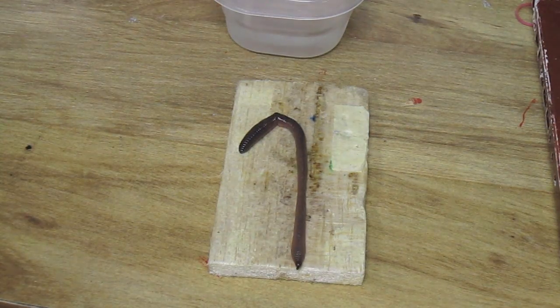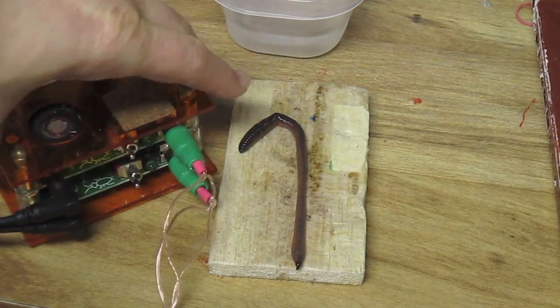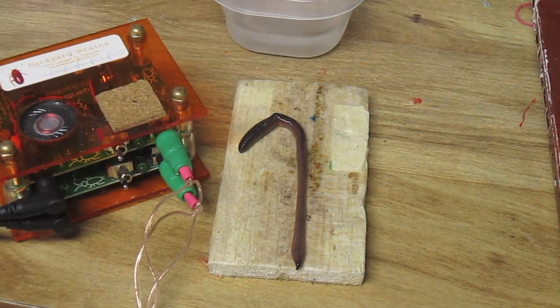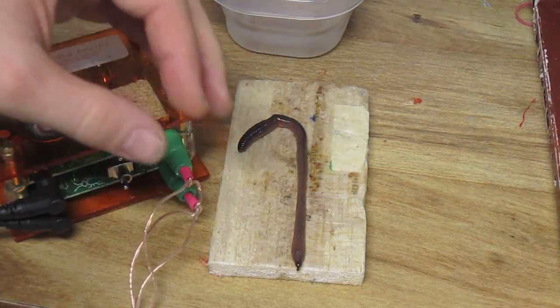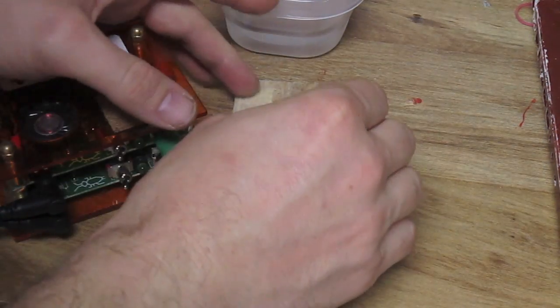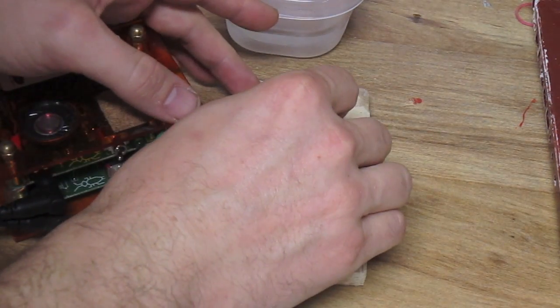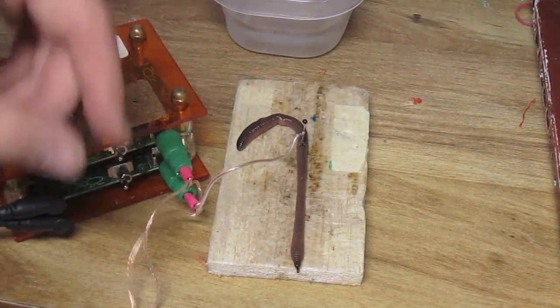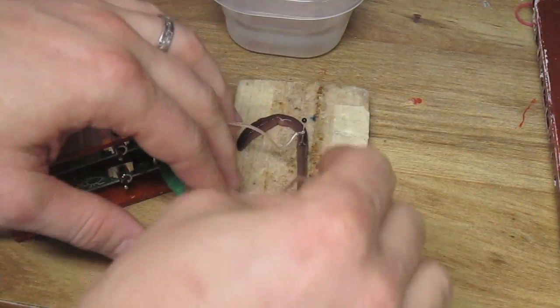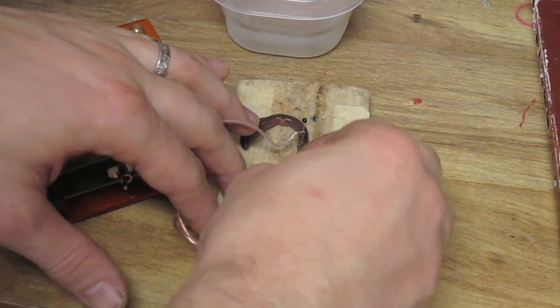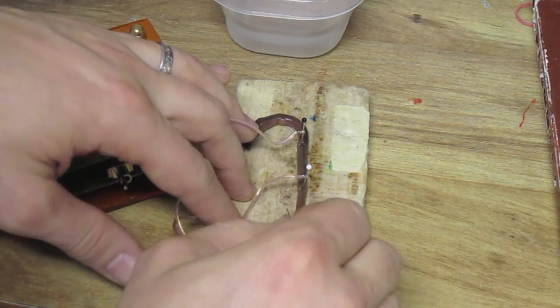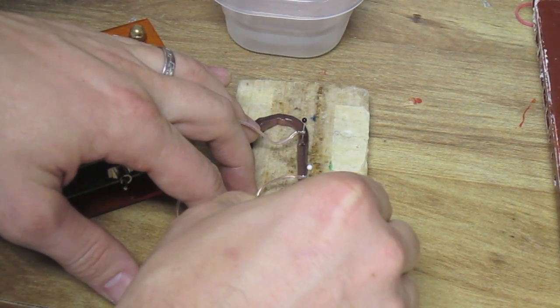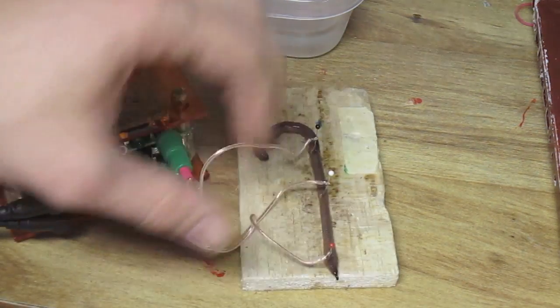Now, you need to make two measurements to measure conduction velocity, and we hereby announce our new two-channel spiker box. The two-channel spiker box comes with three electrodes: a ground I am placing near the anterior end of the earthworm, channel 2 which I am placing near the center of the earthworm, and channel 1 which I am placing near the posterior end of the worm.